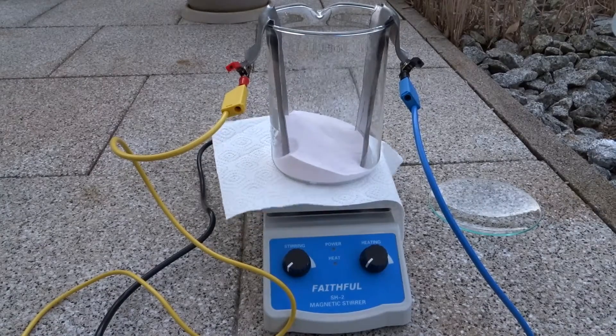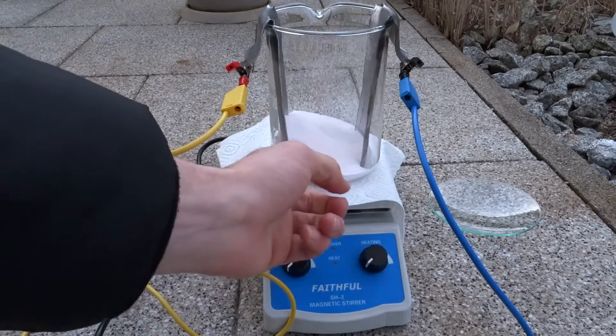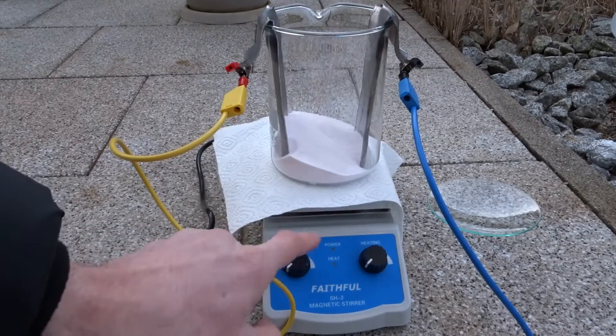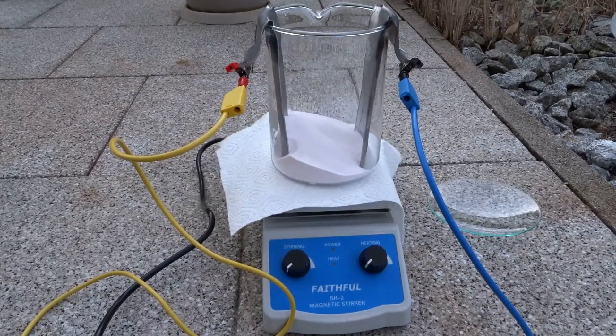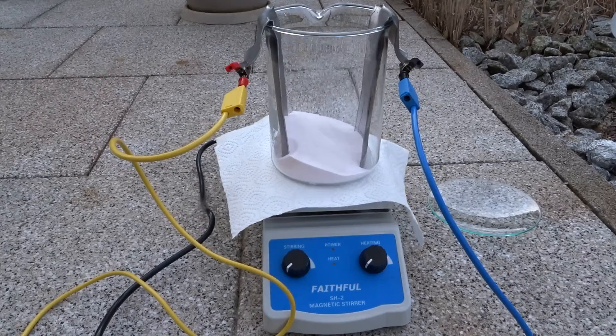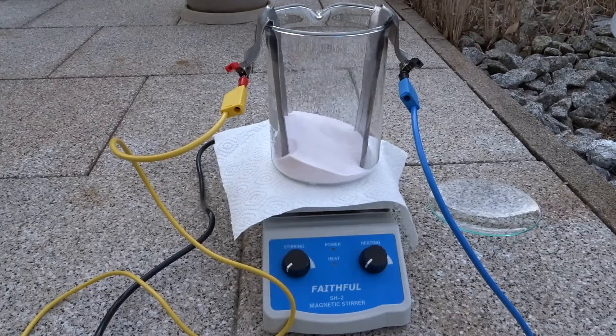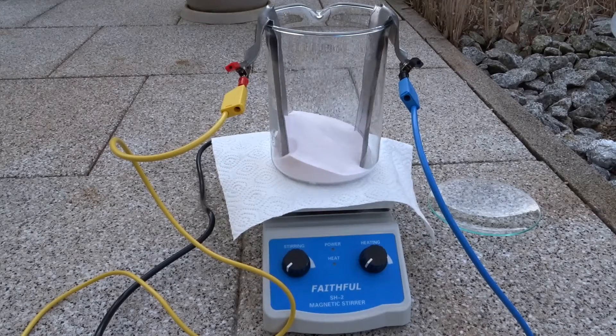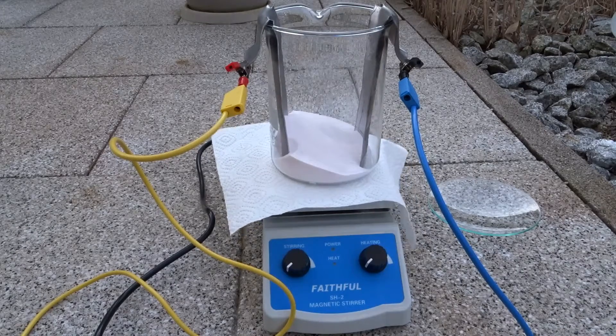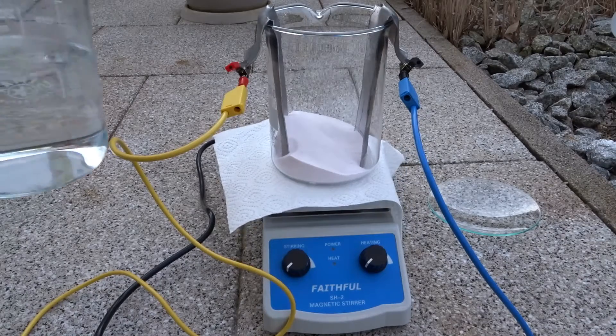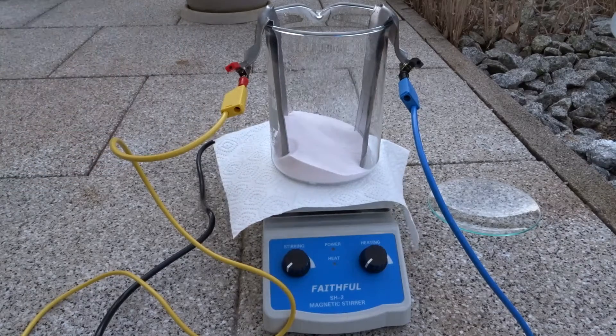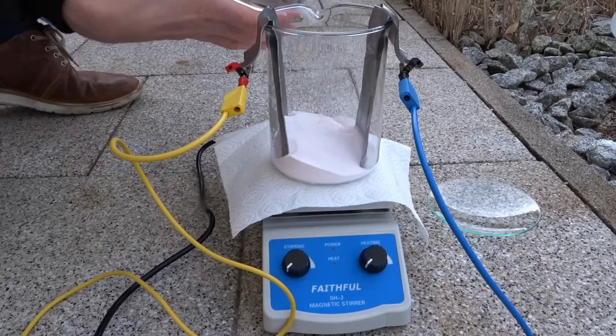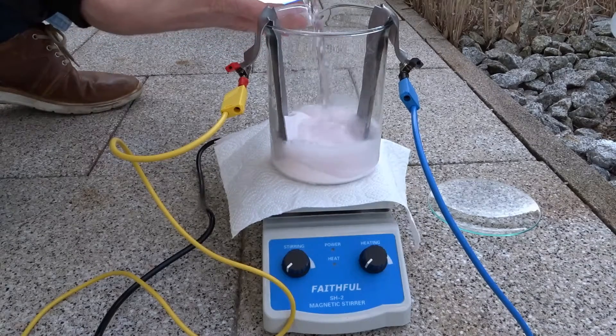Here you can see the overall setup with manganese sulfate, lead electrodes, alligator clips, and everything placed on the stir plate. Now I'm going to take this gigantic beaker to fill in some water.